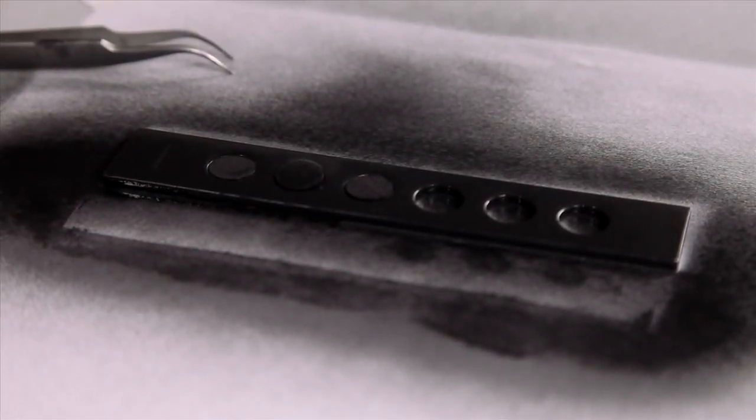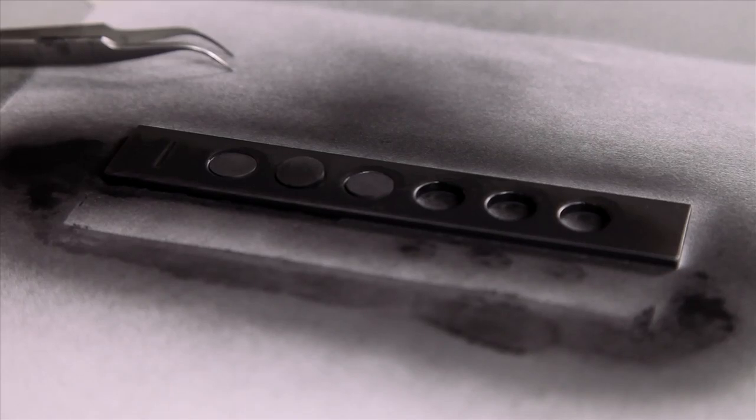You need to make sure that you prepare your reference with the samples at the same time, so you have the same thickness of graphite on all samples.